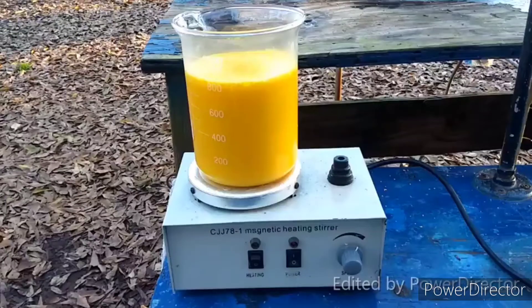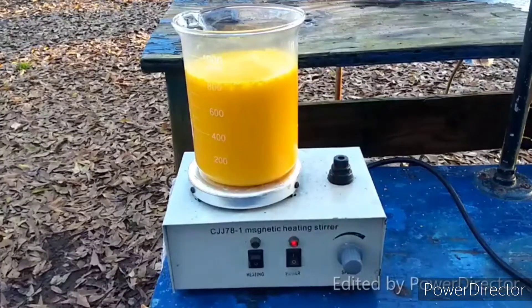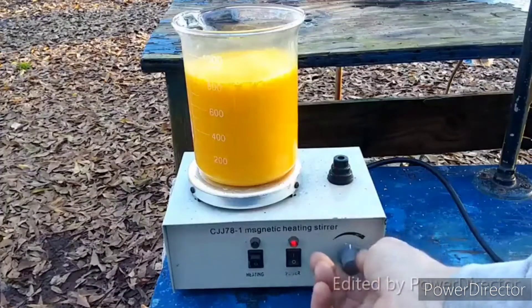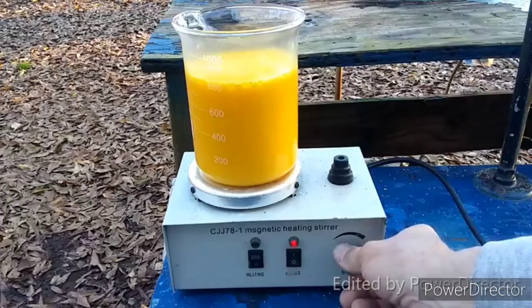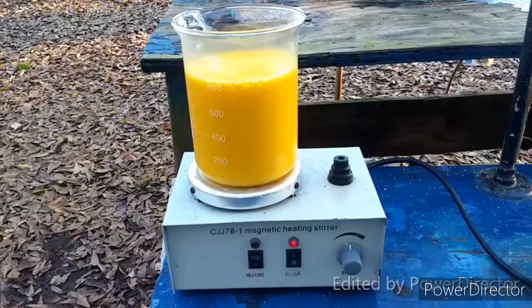And as soon as I make it, some tree debris falls into it — because of course, I just can't have nice things. Arsenic trisulfide is very, very insoluble. I'm not sure why you've got to have the HCl in there to drop it out. You might be able to skip that part and bubble H2S through the solution, but I don't think so. I think it's like antimony where you just have to have some HCl in there in order to get the sulfide to precipitate out.